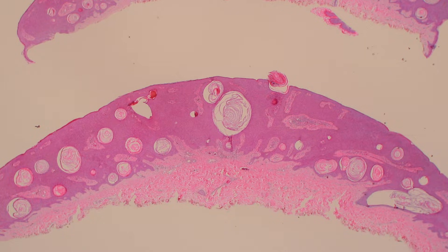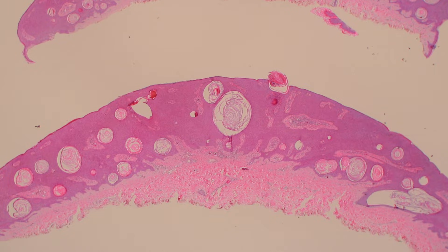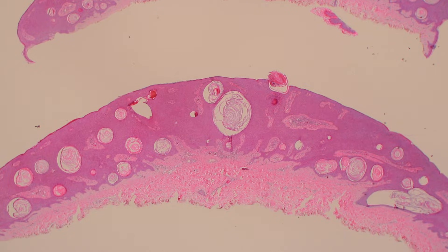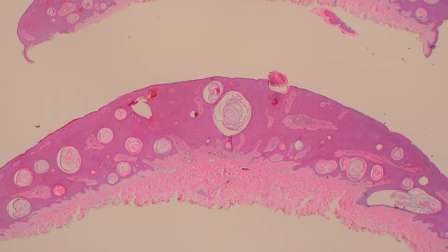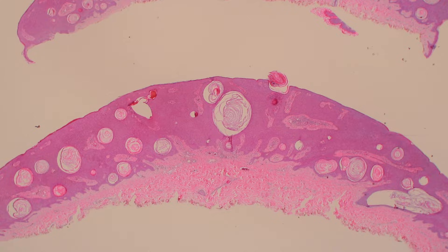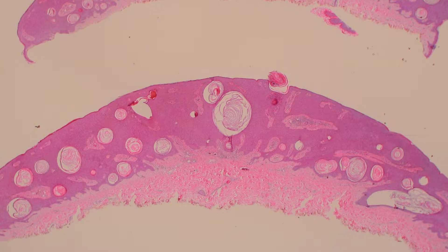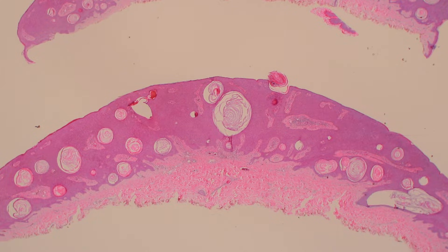Sometimes people, particularly beginners in pathology, get these confused because they're both swirly little whirls of acellular keratin, but they have some differences.